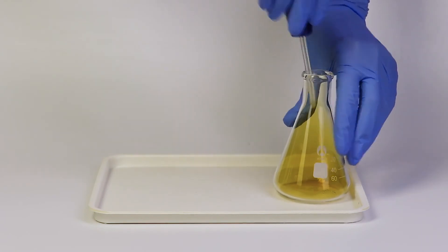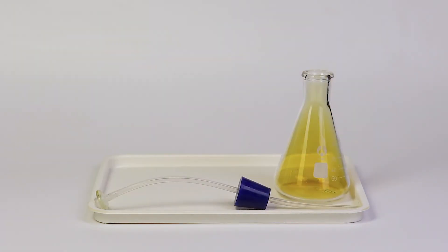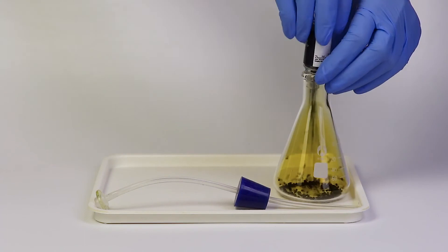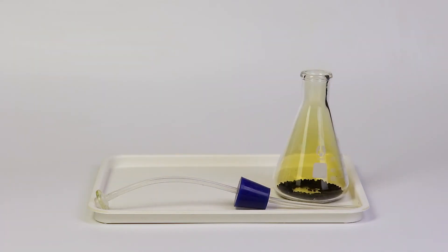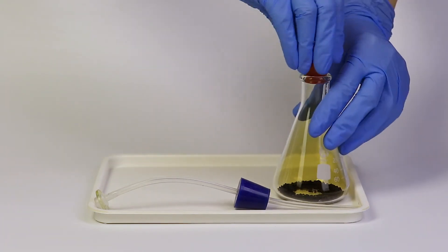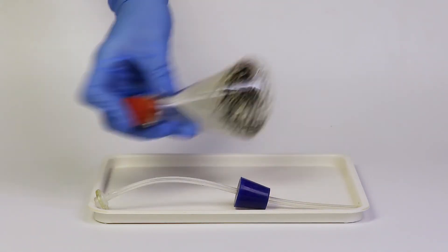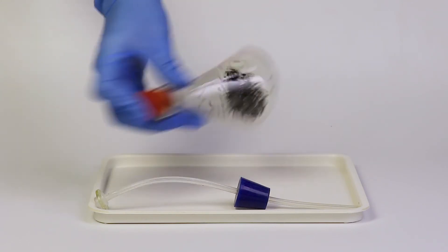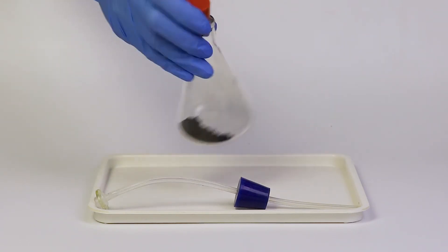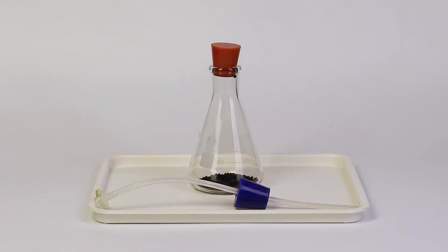Carefully open the flask and pour in there all activated carbon from the bottle. Seal the flask with the rubber stopper with no holes and shake. Being a perfect absorbent, activated carbon absorbs all the nitrogen dioxide so that the contents of the flask turn colorless.